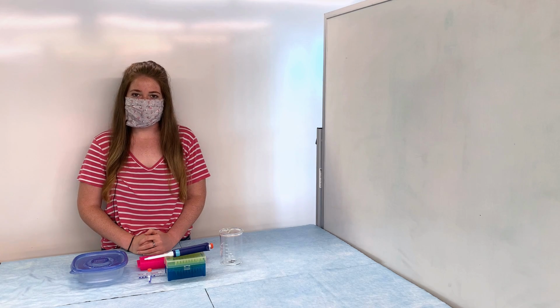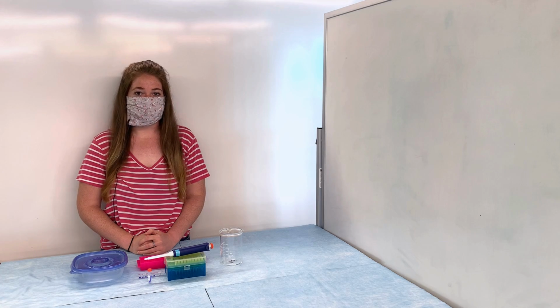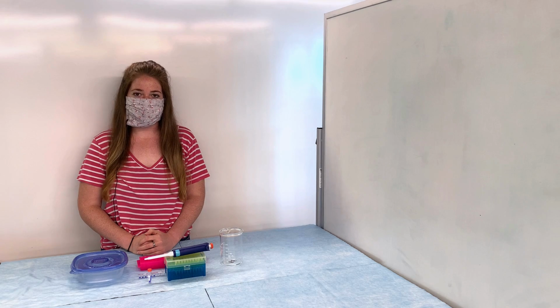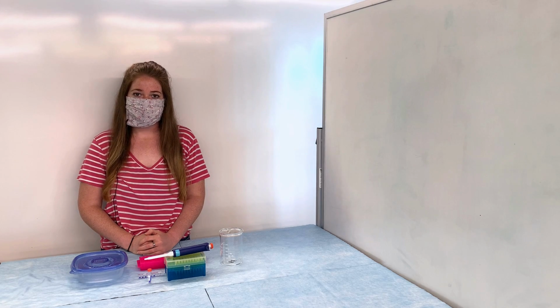If we have a DNA sample from someone we know has sickle cell, we can determine if another patient also has sickle cell. Specifically, running DNA through a gel creates a banding pattern. If our patient has the same banding pattern as a control who we know has sickle cell, then that means our patient also has sickle cell. As I mentioned, in this lab we are going to be studying a family, and we're going to be determining whether or not a mother, child, and father all have sickle cell.